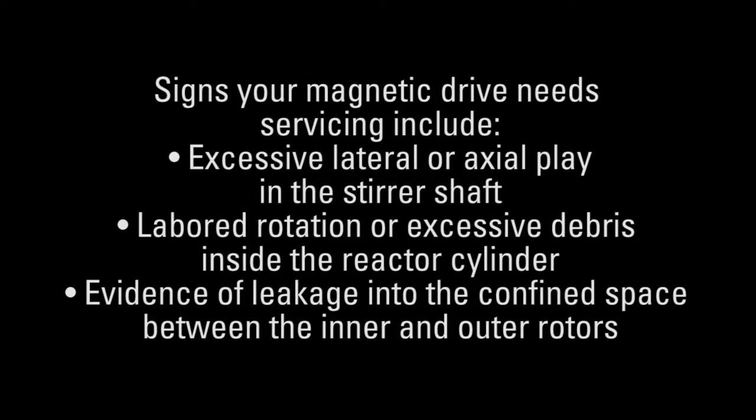Signs your magnetic drive needs servicing include excessive lateral or axial play in the stirrer shaft, labored rotation or excessive debris inside the reactor cylinder, and evidence of leakage into the confined space between the inner and outer rotors. This video will cover the rebuilding of the consumable parts in a Parr magnetic drive.